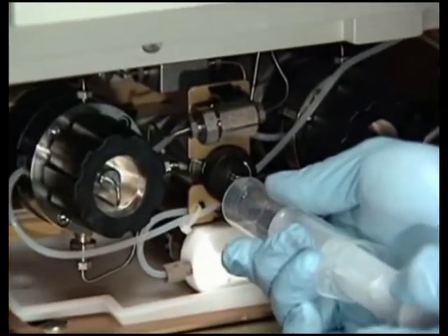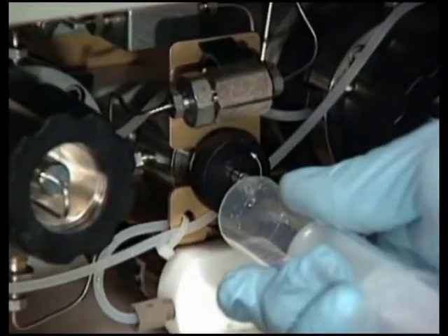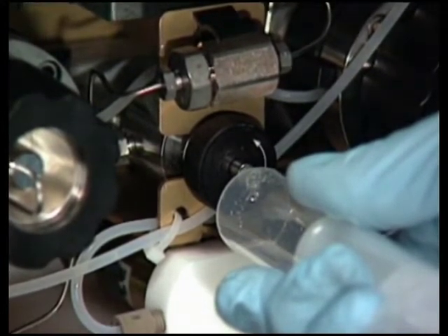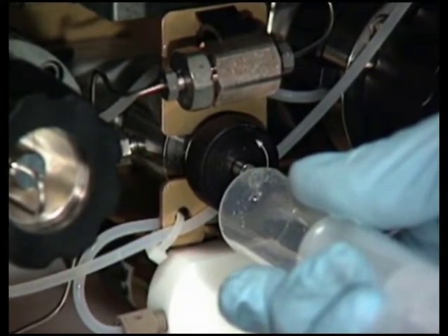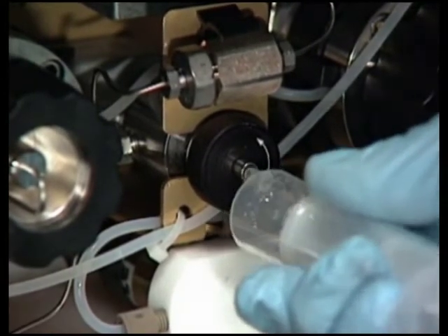You may need to exert force to pull the air and solvent through the system. Continue until you pull all the air through the solvent line into the syringe. Repeat the dry prime for each solvent line you want to use. Then close the prime vent valve.